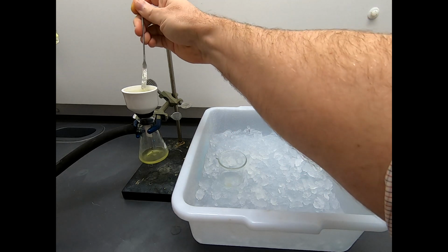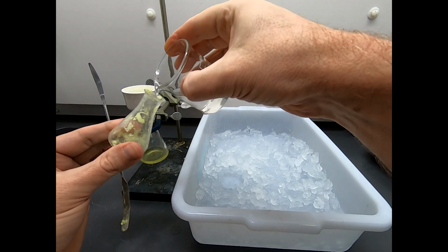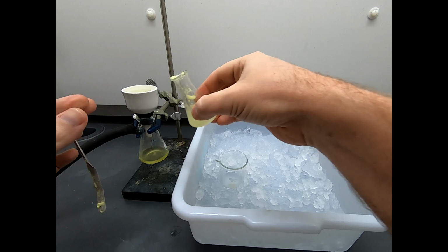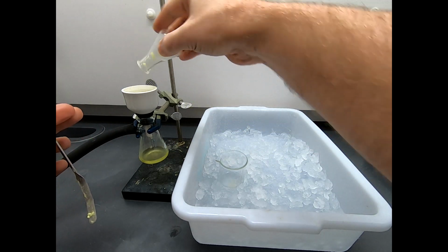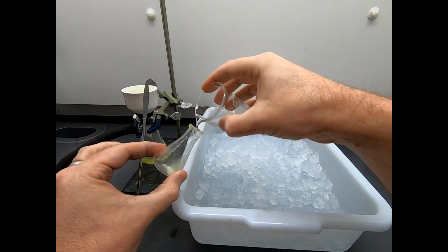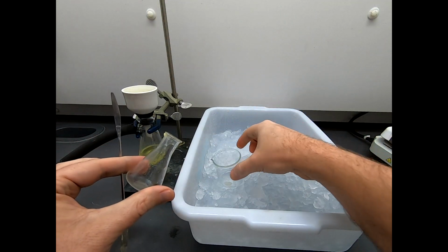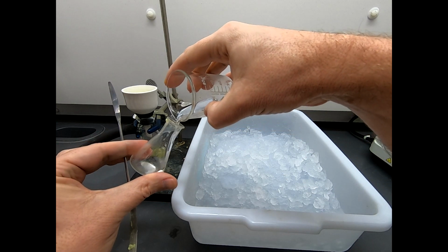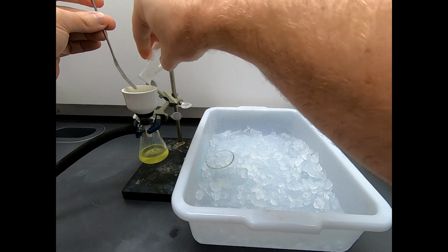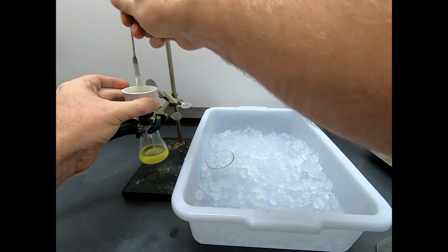I'm trying to smush it around down in the funnel to make sure all the liquid gets drawn out. Now we have our cold solvent. Let's use this as best we can. So that's already looking much better. Let's try one more of those. Sometimes these are terribly difficult, and sometimes they're really not that bad. I'll be honest, that wasn't as terrible as I feared. So that's good. Let's go a little more. And we'll just put a little more in here just to try to rinse out this filter cake that we have. And I'm pressing down.